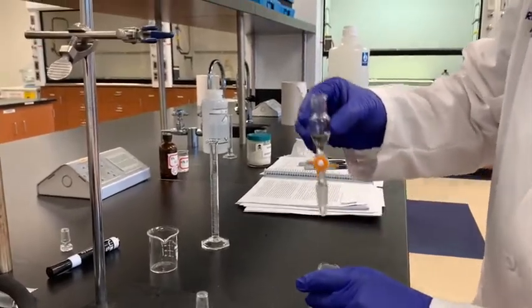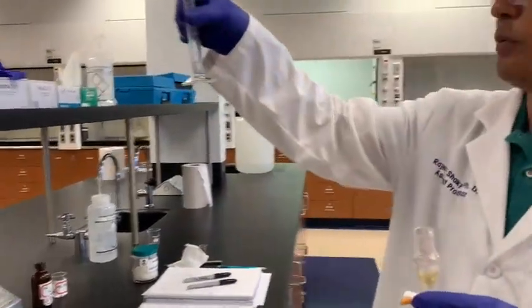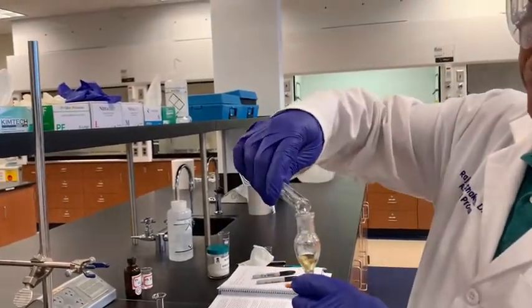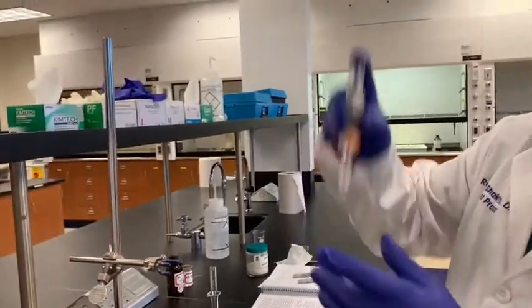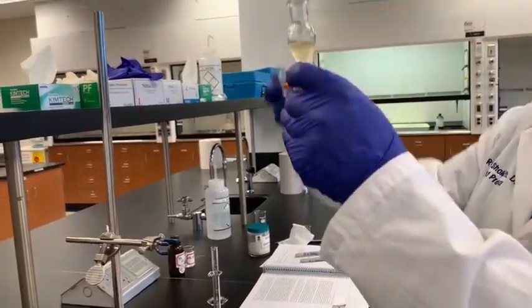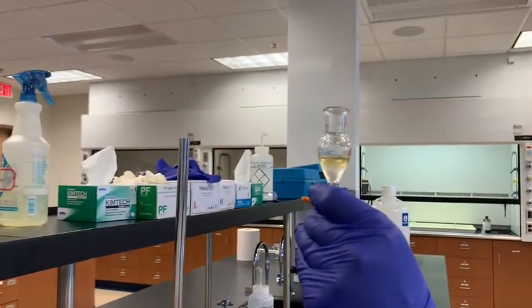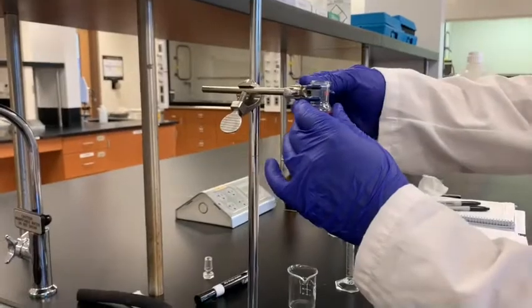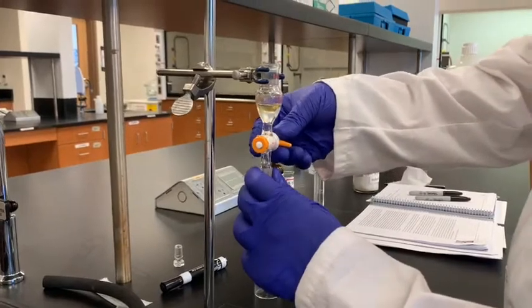All right. After hydrochloric acid, I need to repeat this process with distilled water. Again, I use 2 milliliter of distilled water. This is DI water or distilled water. So just to wash with water, 2 milliliter. Again, I will shake that so that any acidic or basic component will be gone. So just clean that a little bit here. It will form 2 layers. This layer is separating very clearly. All right, so let me set it on the stand here so that I can make a clean separation of that. So the lower layer, I need to draw that out.